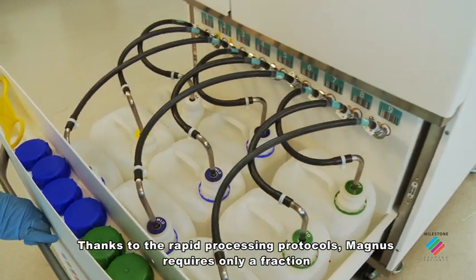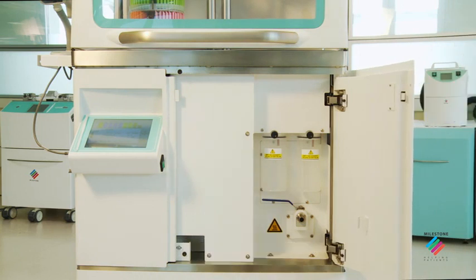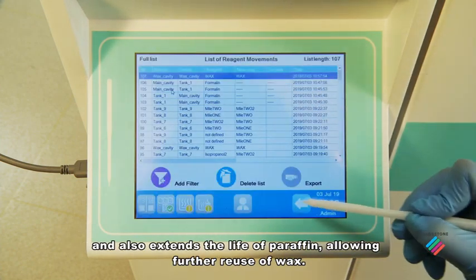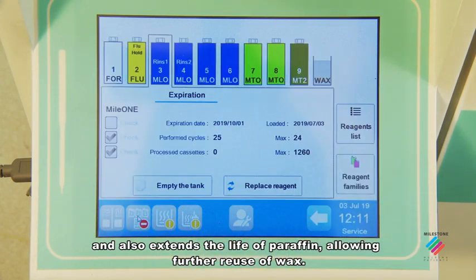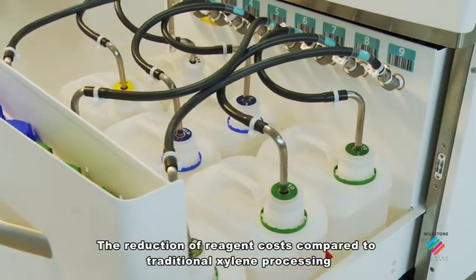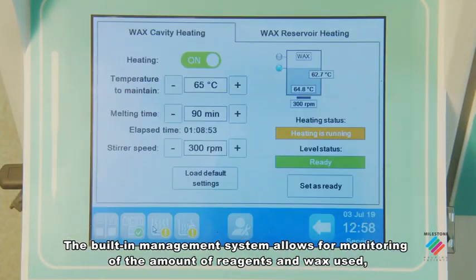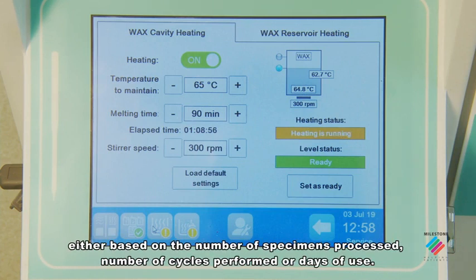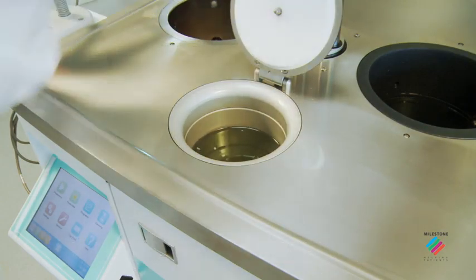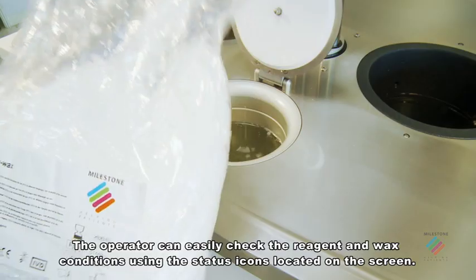Thanks to the rapid processing protocols, Magnus requires only a fraction of the amount of reagents normally used by conventional units. The elimination of xylene has a great impact on toxic reagent disposal costs and also extends the life of paraffin, allowing further reuse of wax. The reduction of reagent costs compared to traditional xylene processing can therefore be reduced by about 30–40%. The built-in management system allows for monitoring of the amount of reagents and wax used, either based on the number of specimens processed, number of cycles performed, or days of use. The operator can easily check the reagents and wax conditions using the status icons located on the screen.